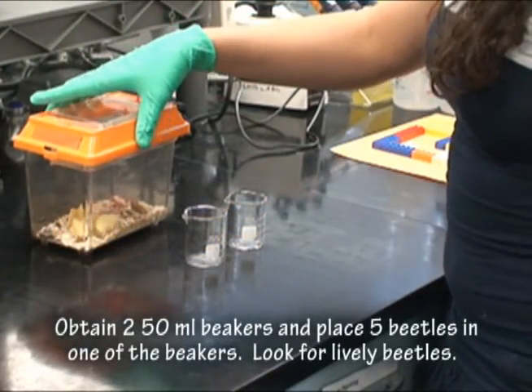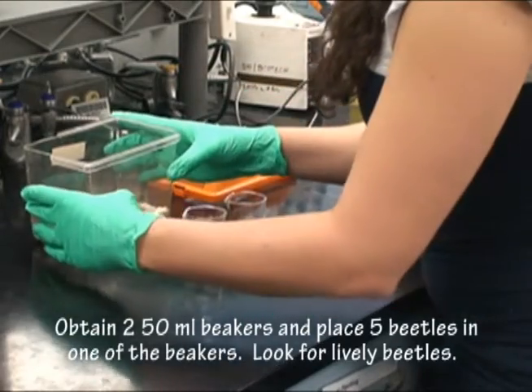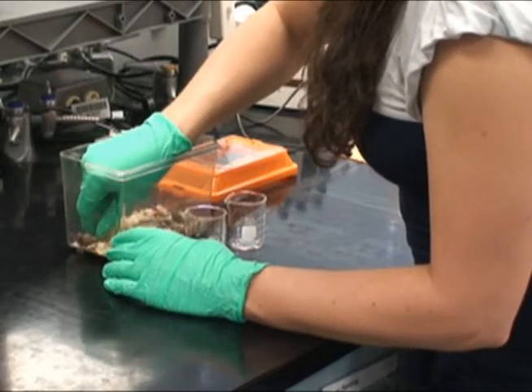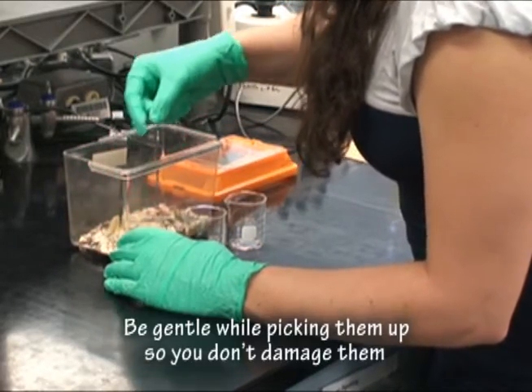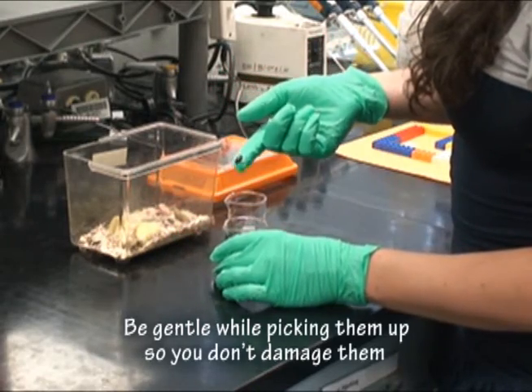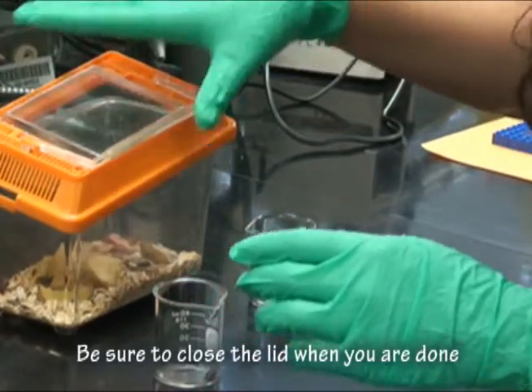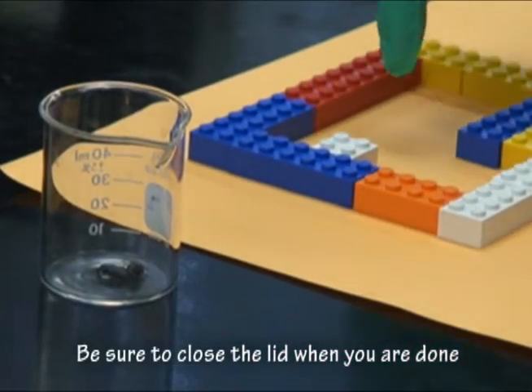Obtain two 50ml beakers and place five beetles in one of the beakers. Look for lively beetles. Be gentle while picking the beetles up so you don't damage them. Be sure to close the lid when you are done.